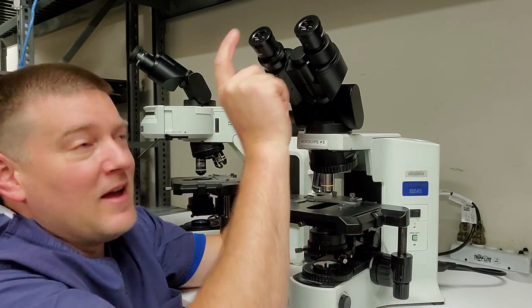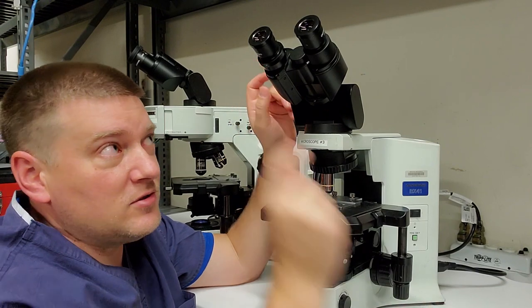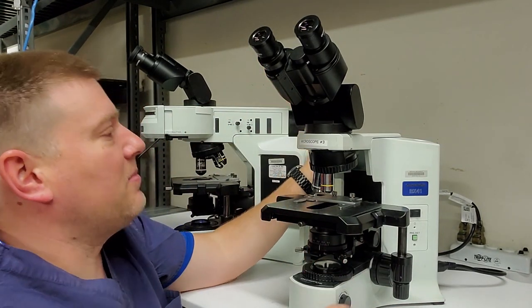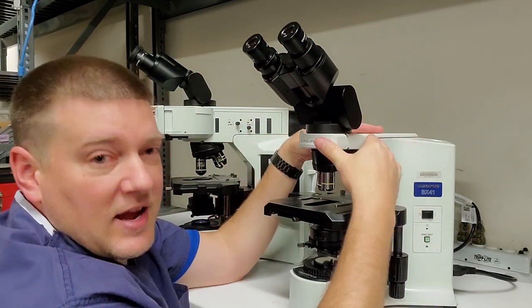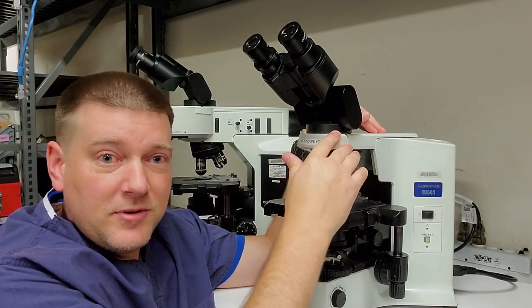They're very expensive. Hell, just the oculars themselves are about $1,000 to $1,200 each. There's two of them, $2,400. Okay? Don't drop them. So next thing down is going to be your headstock, which you can see, as I explained already, there's multiple different types of headstocks.